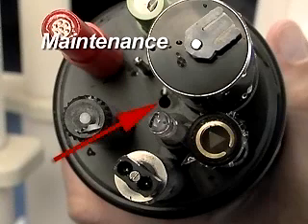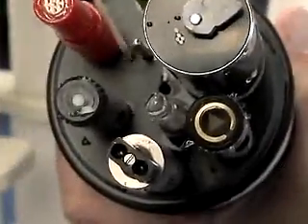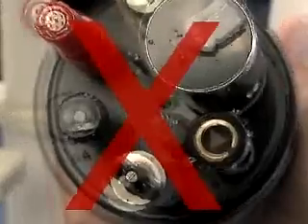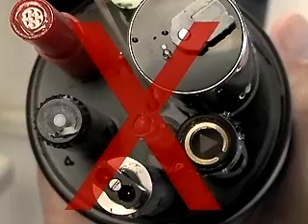Maintenance. The only maintenance required for the depth sensor is to keep the opening in the sonde free of blockage. When cleaning the sonde, debris and organisms should be removed from the opening. Never poke a tool or cleaning implement into the opening. The diaphragm inside the sensor can be dented very easily, which will destroy it.